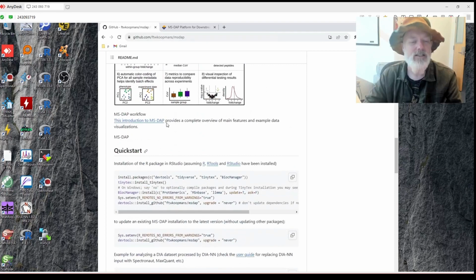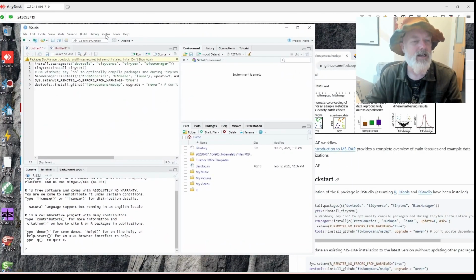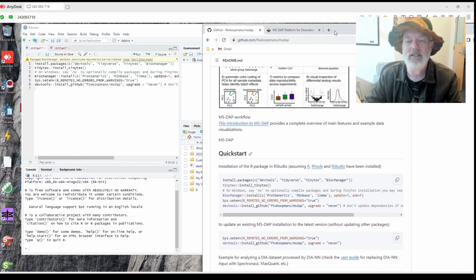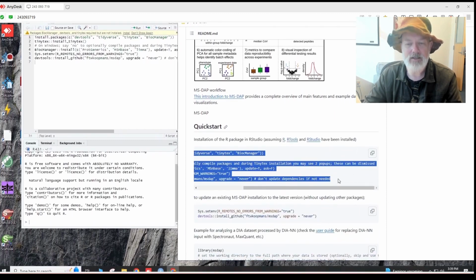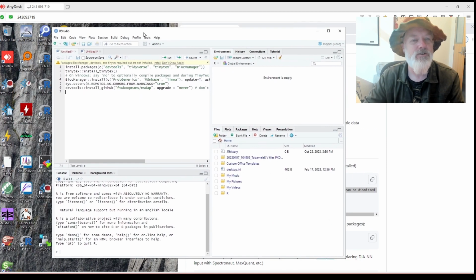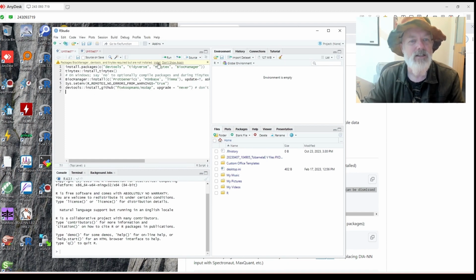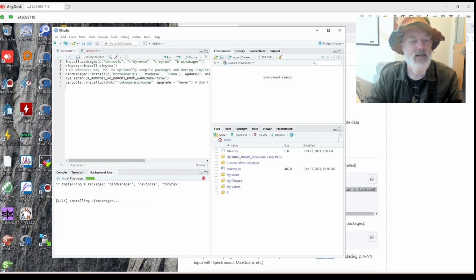Okay, so first thing I did was I installed R and RStudio. And I copied this little install script here, from the quick start. So just copy it all, and you can hit this little button, which is kind of cool, and then paste it in there. This version of RStudio is pretty neat. It says we don't have these packages installed. If you want to install them, hit the install button. Boom. Okay, let's see what happens.